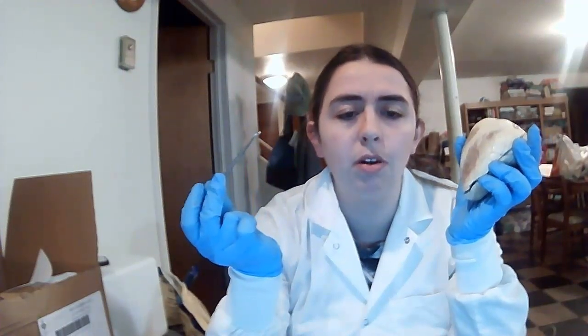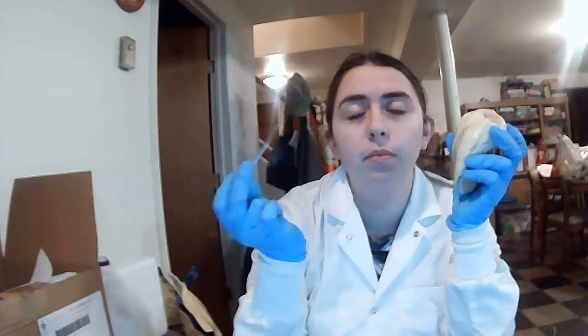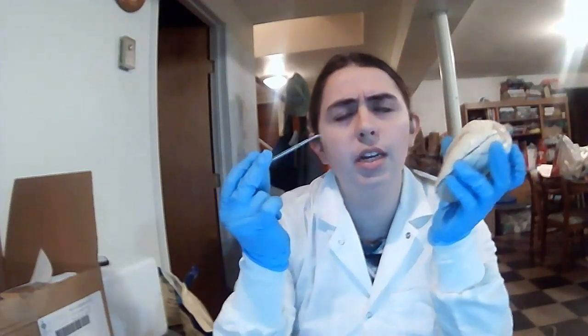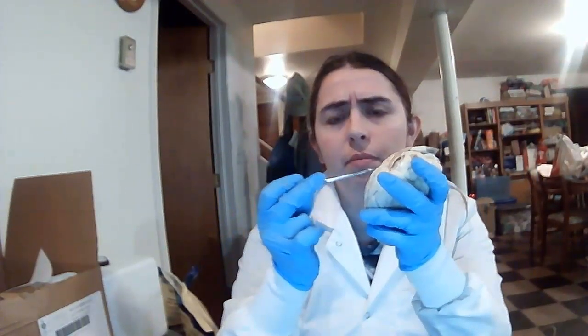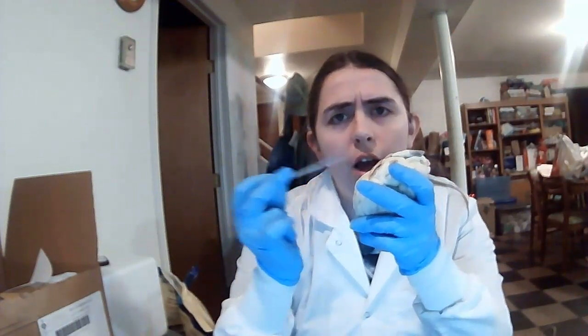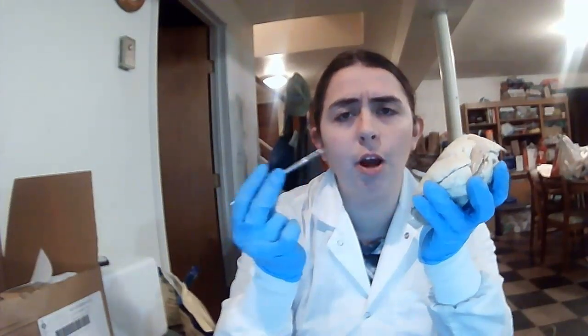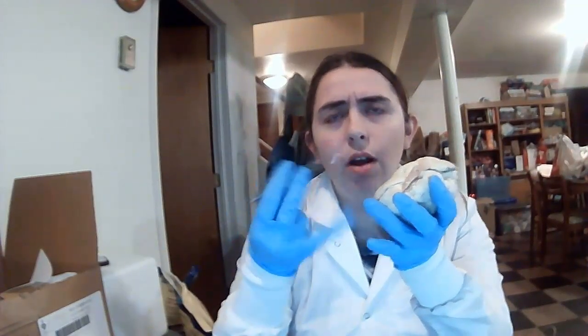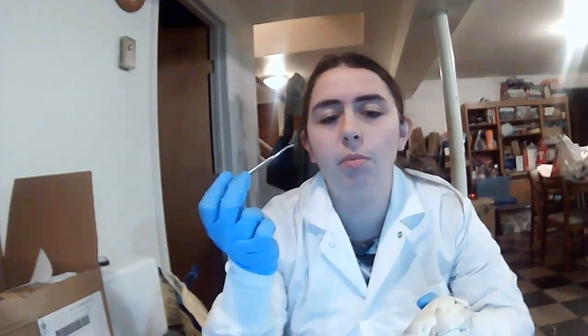And then we'll move on to the pulmonic valve, which is roughly located over here, around the left, above the left atrium, right by all the other valves. It comes from the right ventricle, so it's the artery that transports the deoxygenated blood up to the lungs, where it gives off the waste product of carbon dioxide and gets oxygen to become oxygenated blood. And then I will move on to the different layers of the heart.